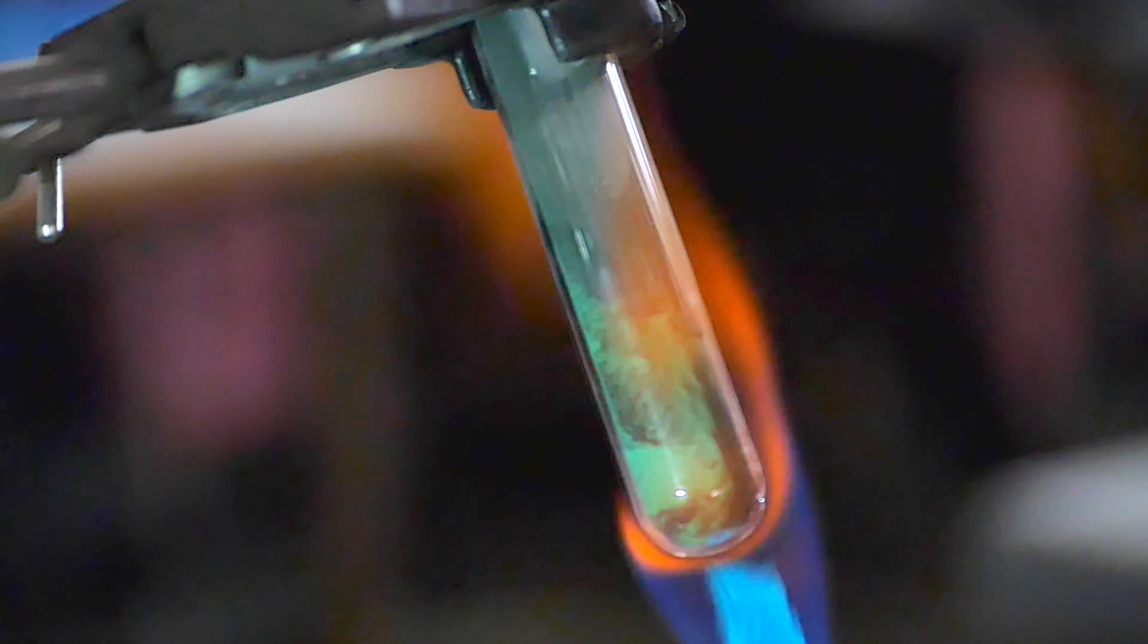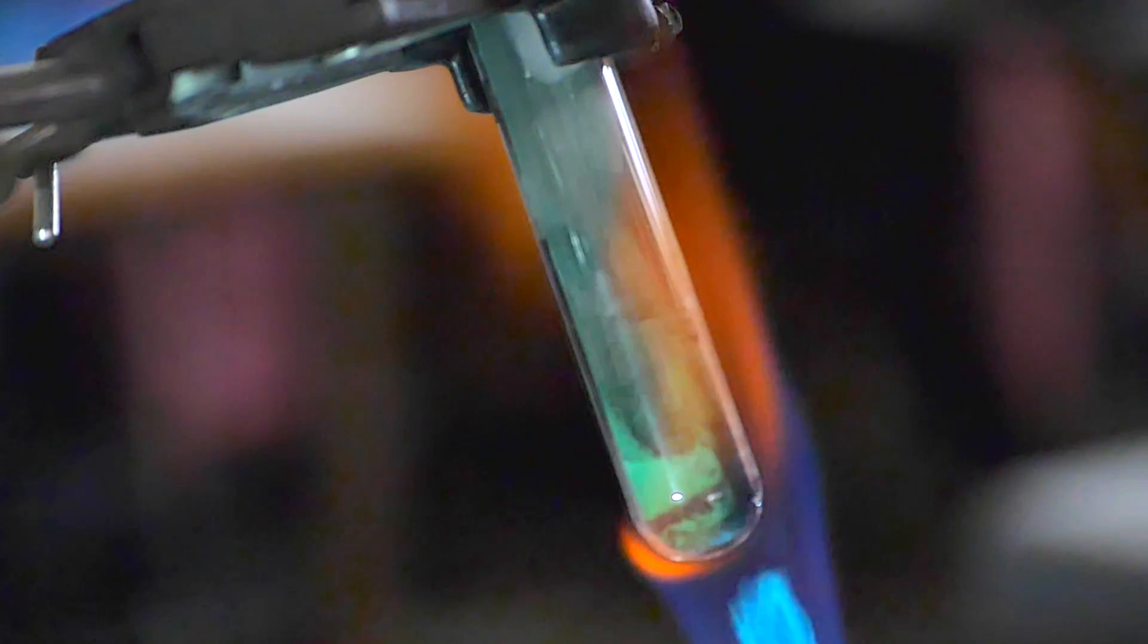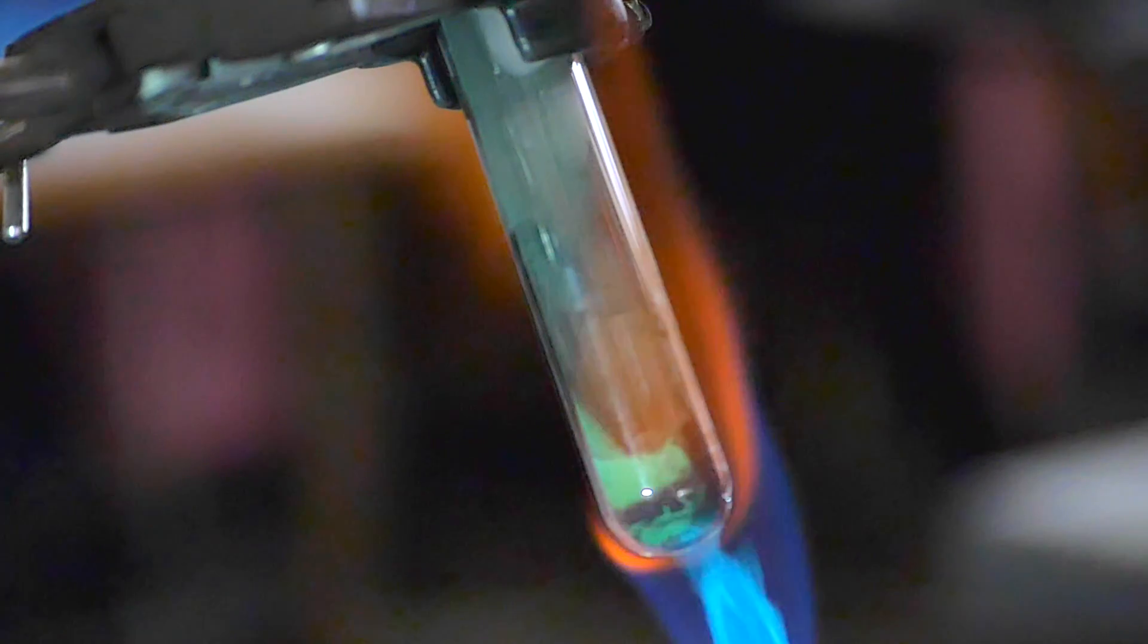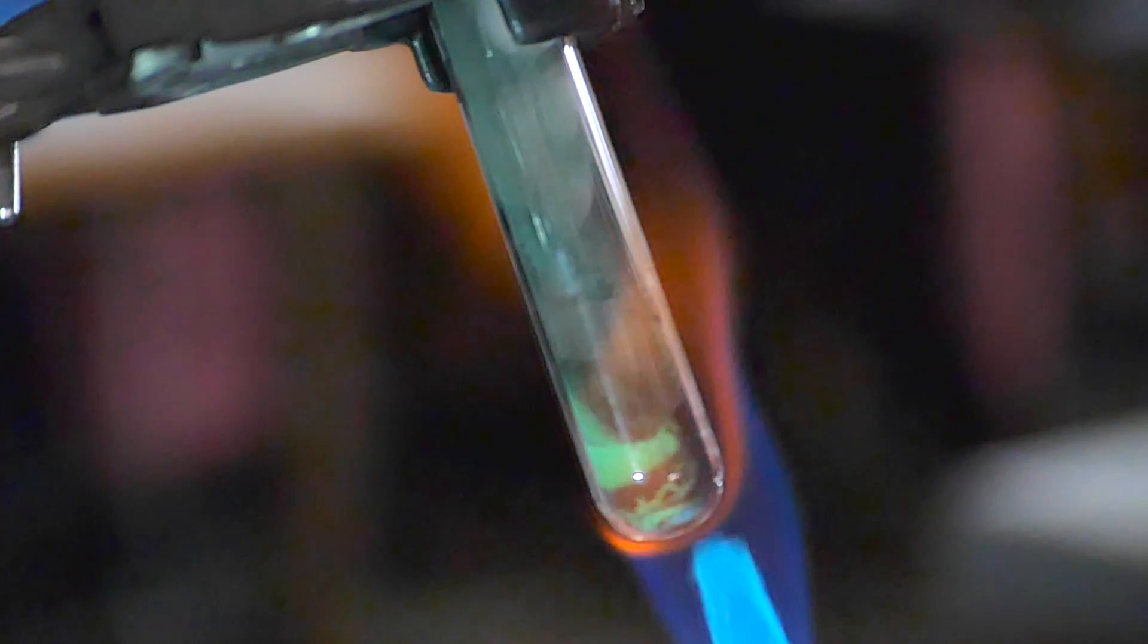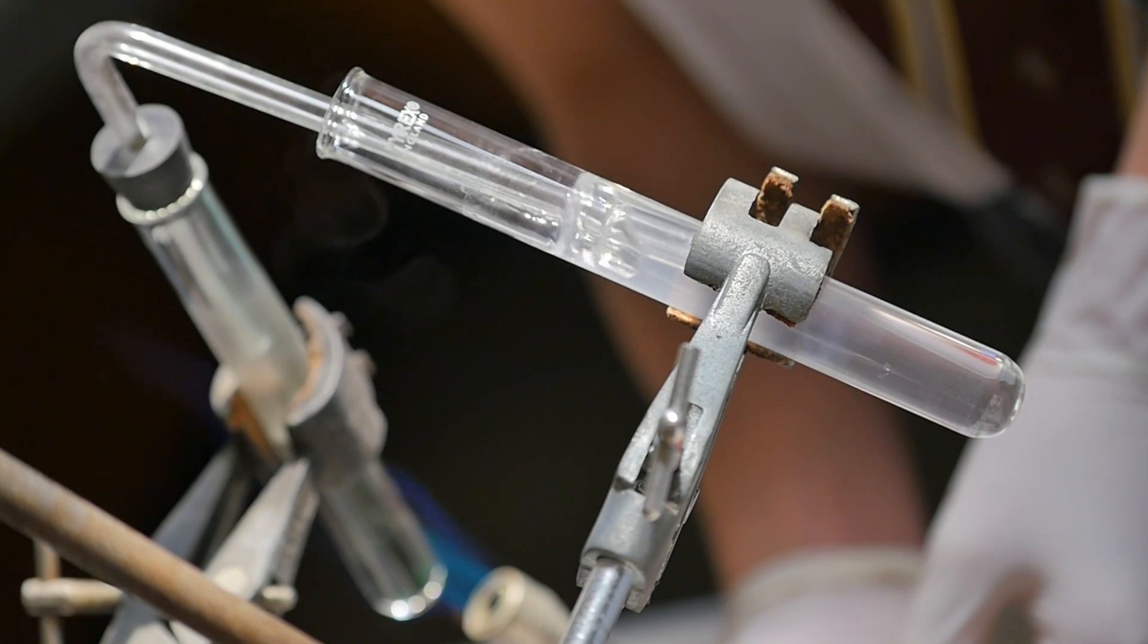What this is, has it disappeared entirely? Has it changed somehow? Oh, it's changed black. It's gone from green to black. We've created something different. What we've created here is copper oxide. So that's one of our materials.